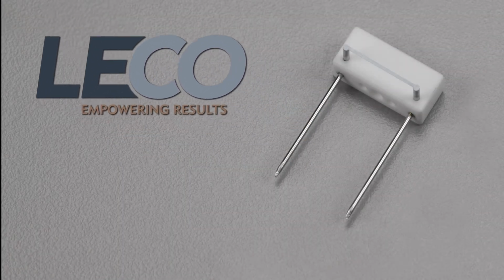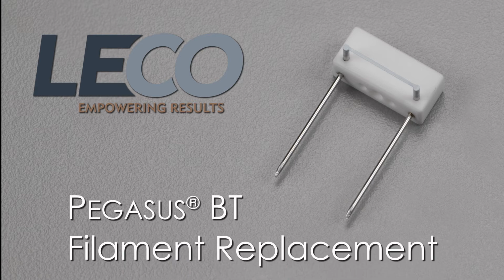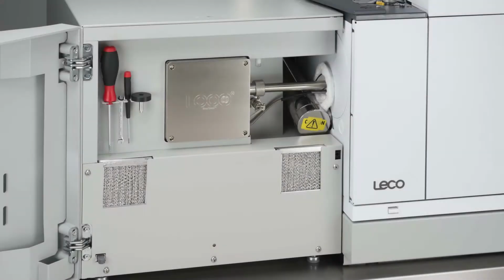Changing filaments on Leco's Pegasus BT and BT 4D is a very quick and easy task, thanks to the innovative design shared by both instruments. This video will walk you through the steps to complete this task. All tools needed are located inside the oven door.